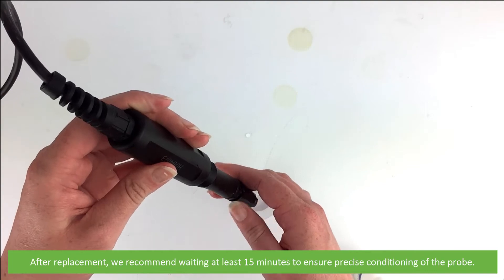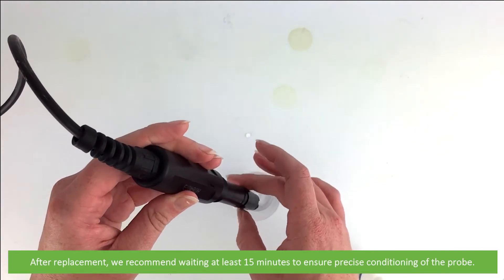After replacement, we recommend waiting at least 15 minutes to ensure precise conditioning of the probe.